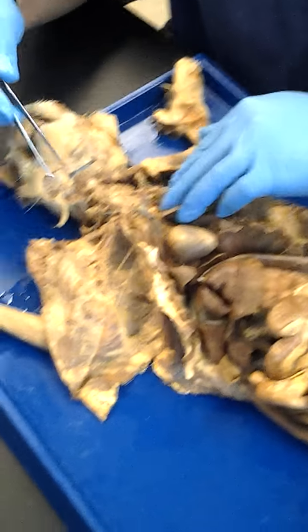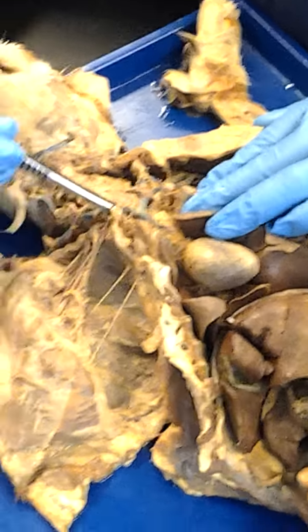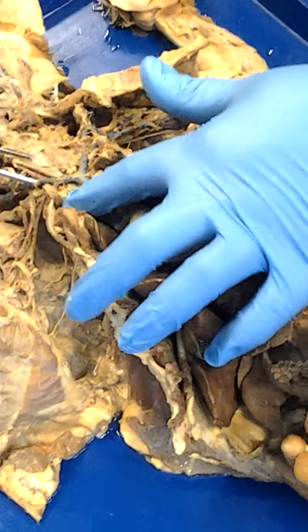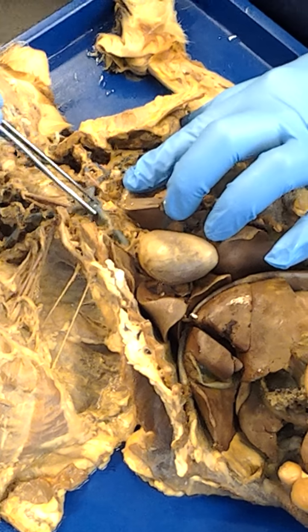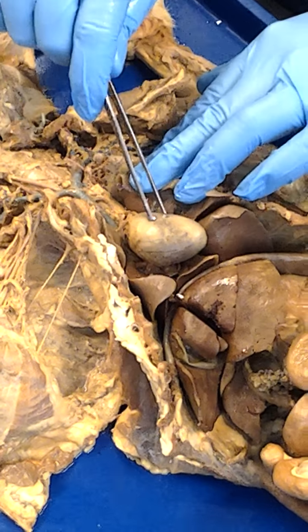As we move downwards, we can see here, here's the jugular, heading down, and then it connects to this structure right here, and this is actually going to turn into the brachiocephalic. So here's the brachiocephalic here, and another one right here. And these two brachiocephalics here and here actually merge together to form this structure right here, which of course is the superior vena cava. Note that the superior vena cava heads towards the heart.